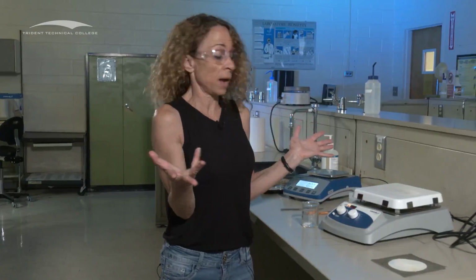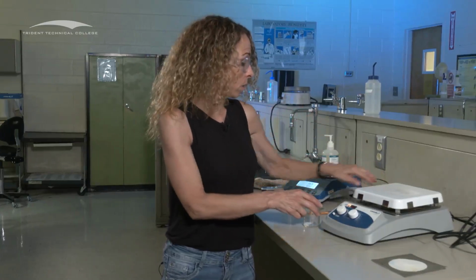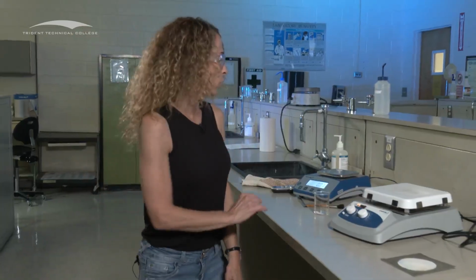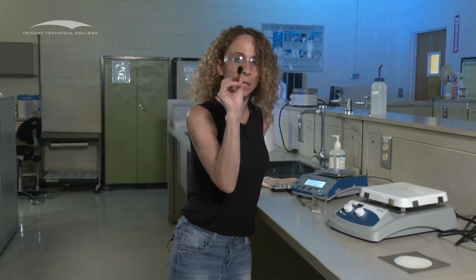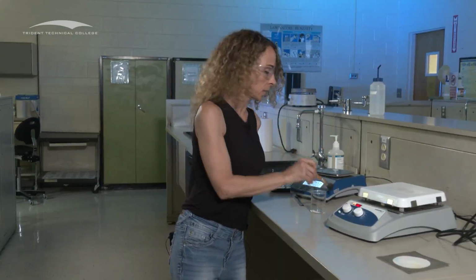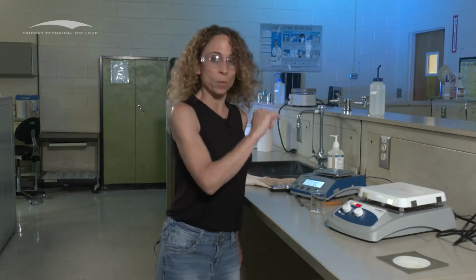And now let's say I'm finished: oh look, I got the 0.01, I crossed that hurdle. What are you going to do? I'm done, I'm going to leave? No, you're not. You're going to make sure that your balance is clean. Brush it off for the next person. Clean your balance. I'm not turning it off, other people are using it.